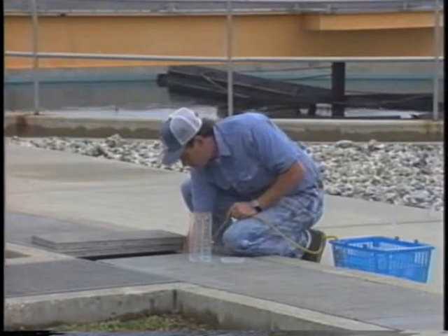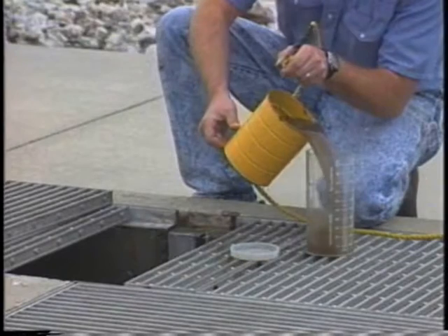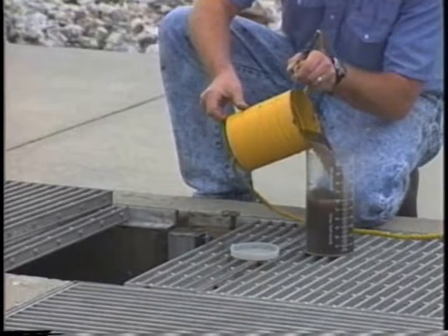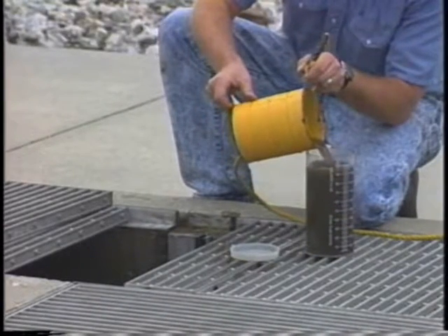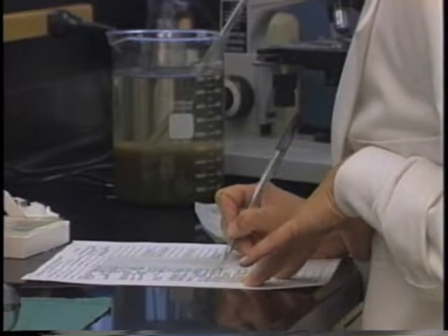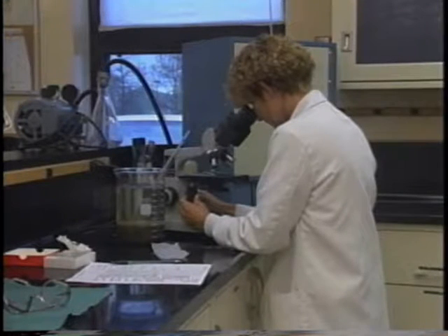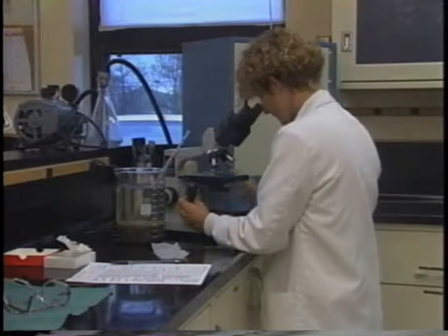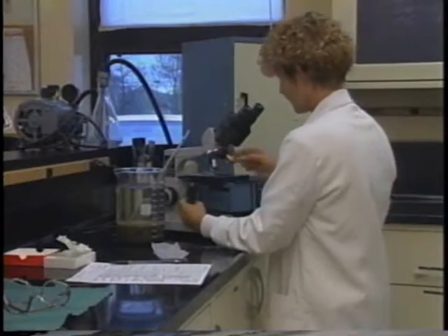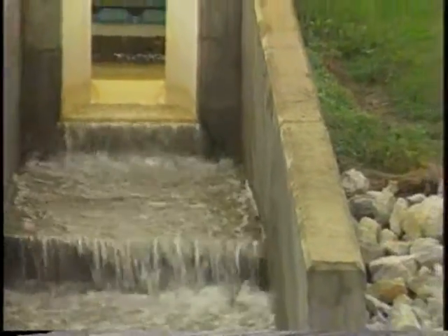Through the regular monitoring and identification of microorganisms in an activated sludge system, the operator can often prevent serious operational problems. A daily microscopic evaluation can be a very useful tool in the routine operation of a wastewater treatment facility. It could also prove to be a new and enjoyable experience for the wastewater treatment plant operator.